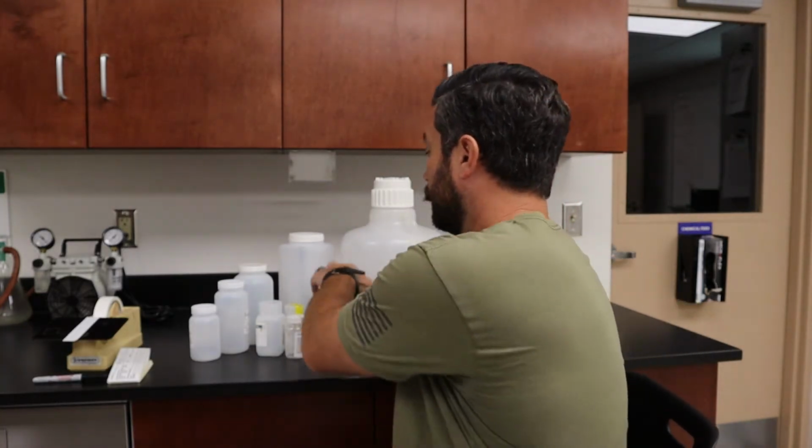Okay guys, one more thing about the bottles before we go out. Wanted to show you these bottles here. If I went outside and I took a sample and I put it in my refrigerator, and it's just a bunch of dookie in here, and the next operator behind me comes in and they're like, I don't know what this is. It's some kind of liquid. It looks like mixed liquor. I don't know where it's from though. The digester, the aeration basin, where?